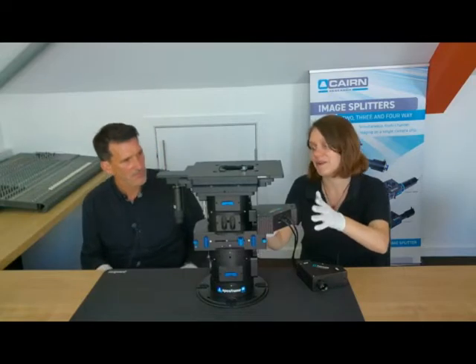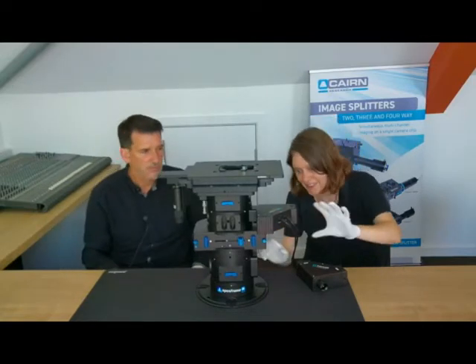Alright, I'm going to talk about a couple of our light sources as well as some of our custom built modules that we've done specifically for the openFrame. So here you can see our Fura LED head, which is a dedicated dual wavelength Fura 2 illuminator at 340 and 380. It's a lovely compact module, so it works very well with the openFrame. As you can see, it fills up the module space nicely without interfering with too much.